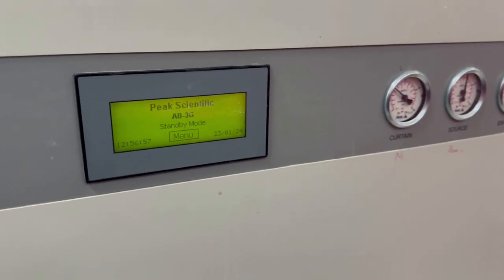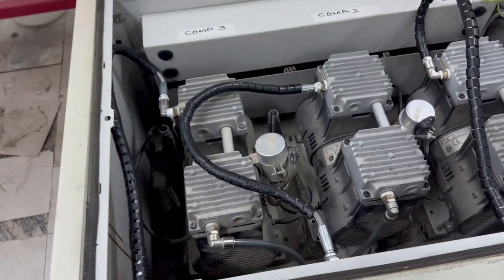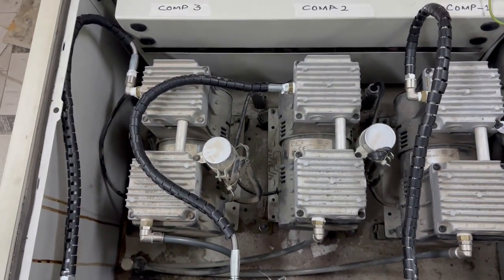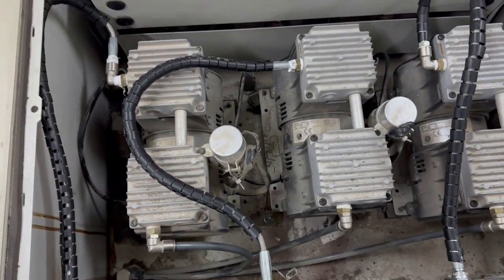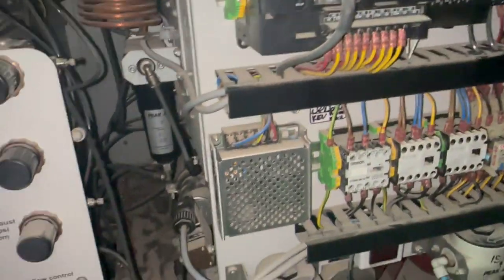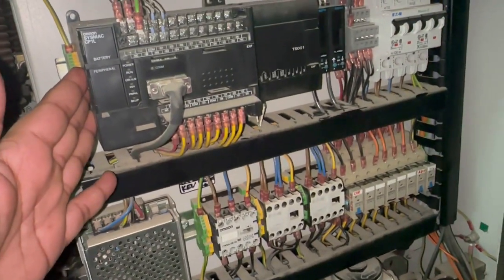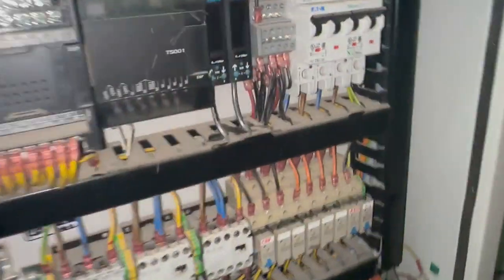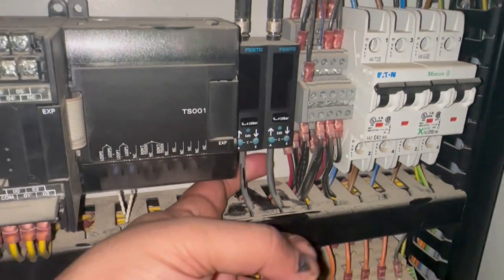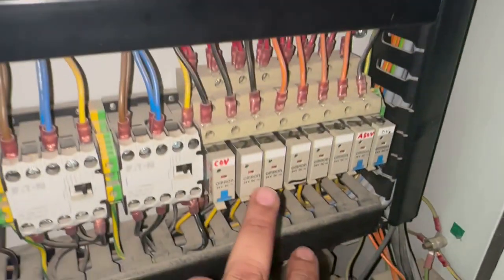So this is the final situation, and here we have the new pipes. This is its control part. Here we have the PLC, IO card, some pressure switches, circuit breaker, contact relays, magnetic contactors, power supply.